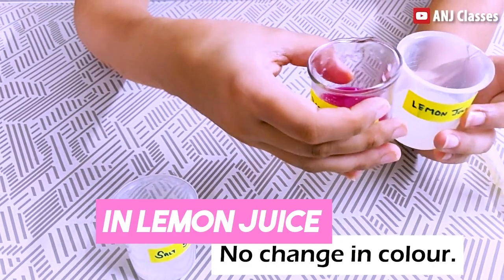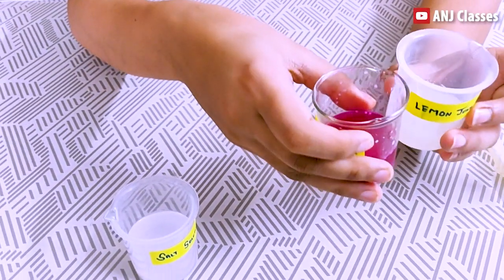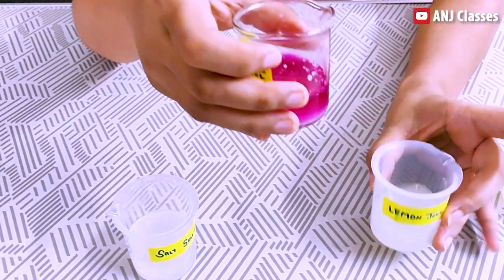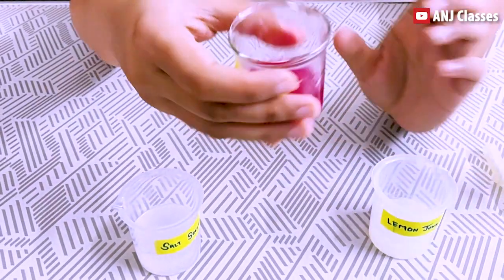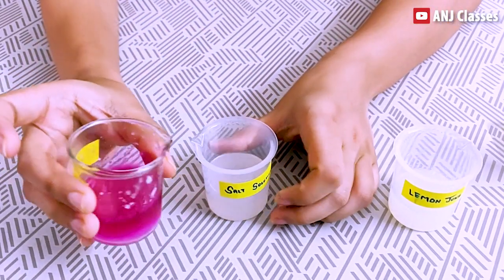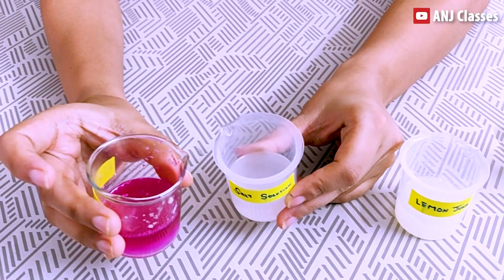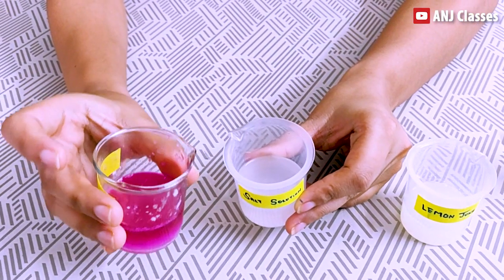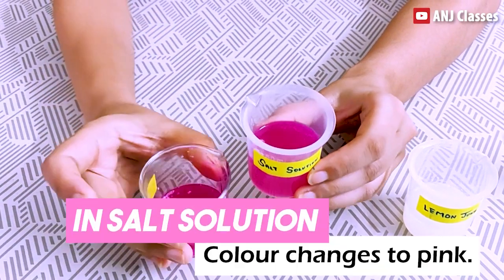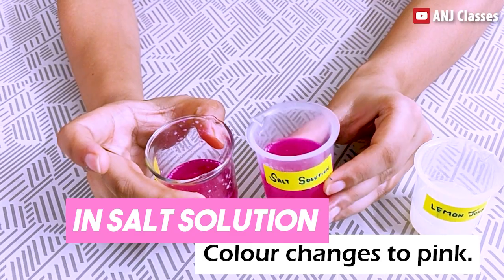You can see there is no change in color because the acidic solution cancels the effect of the basic solution. Now I will add my basic solution into my salt solution, that is my neutral solution. You can see it also changes to pink color.